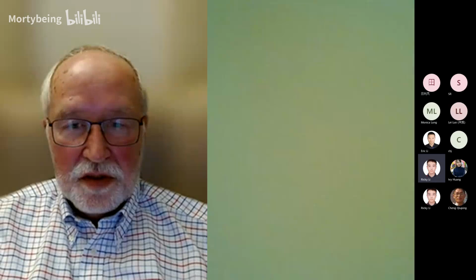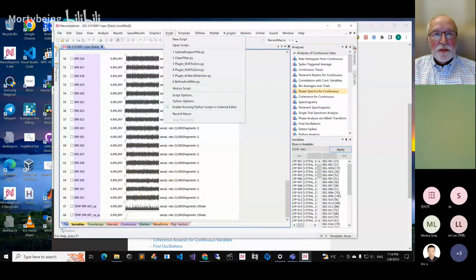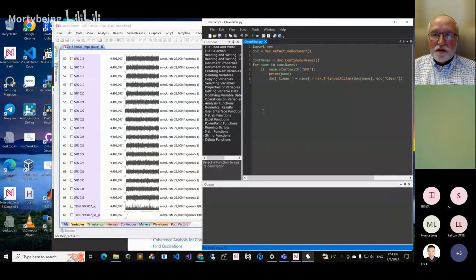Let me share the whole screen. So you go to script, and for example, I have this script to apply interval filter to all variables. So this is the whole script, and you get the document, you get the names of the continuous variables, and then for each SPK variable, you apply interval filter. So the same idea will be here. Instead of interval filter, you will have a notch filter. So that's the whole procedure of doing this for all the channels.